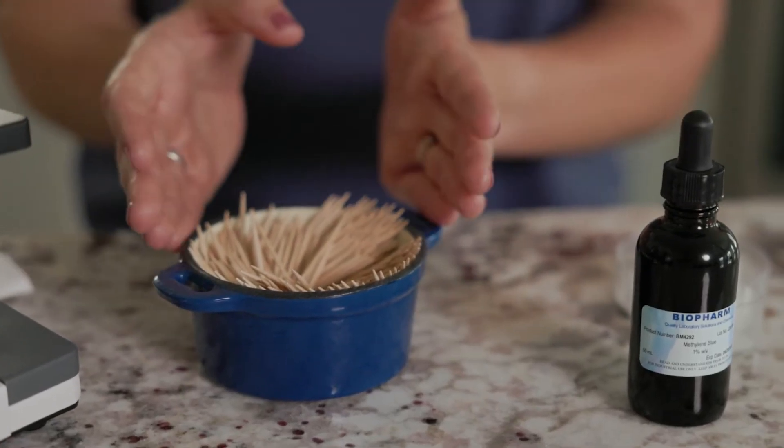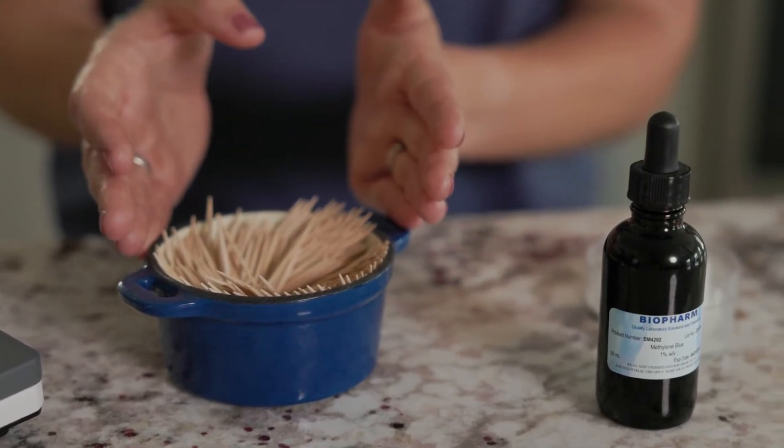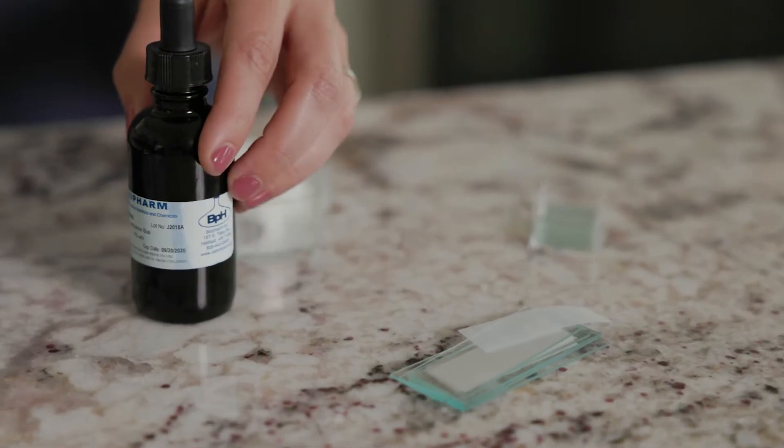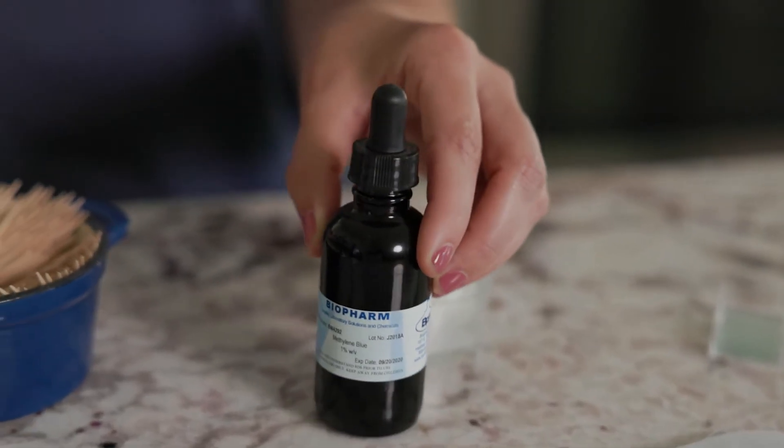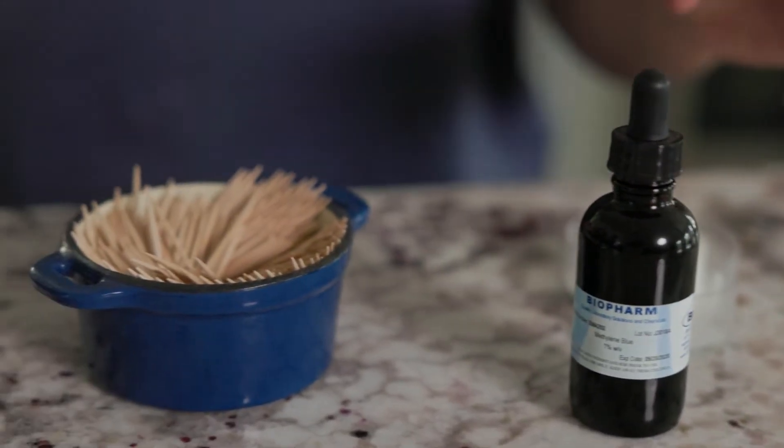Let's get started by preparing our slide with a skin cell specimen. For this we will need a clean toothpick, a microscope slide and cover, and a methylene blue solution.